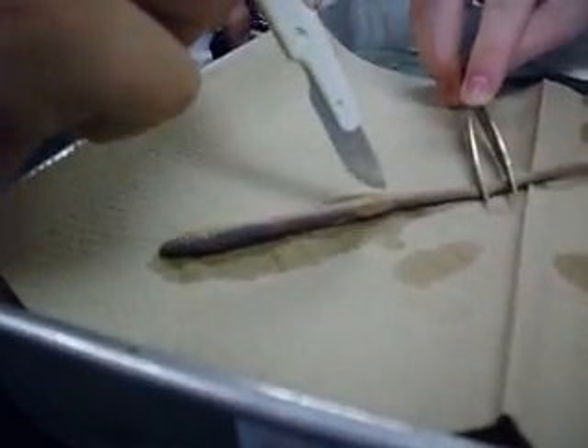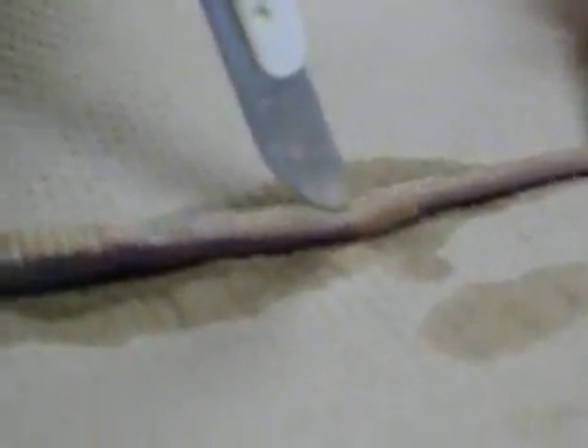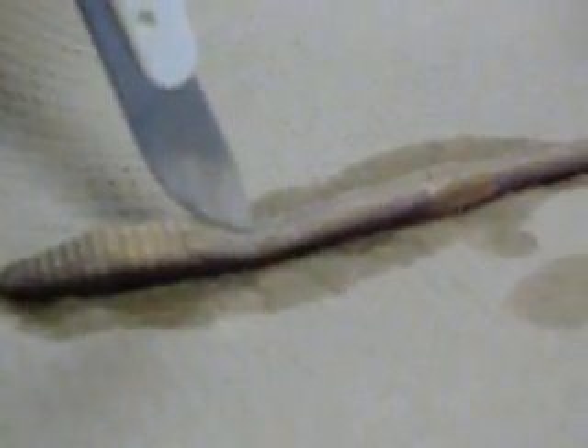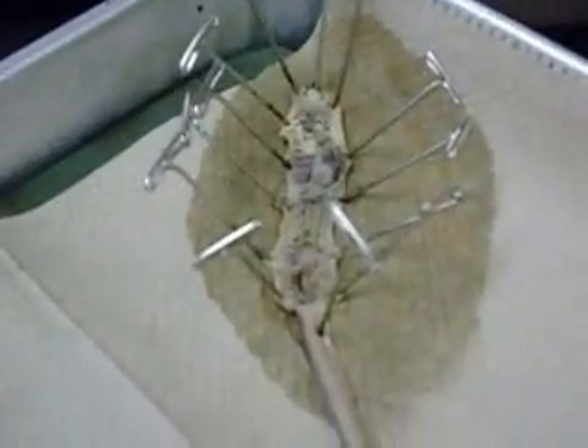All you have to do is look. One down. Take the cap, we'll just slide it through. It's pretty tough. Go through about three or four times. This is our finished work. Voilà — it is a dissected worm.